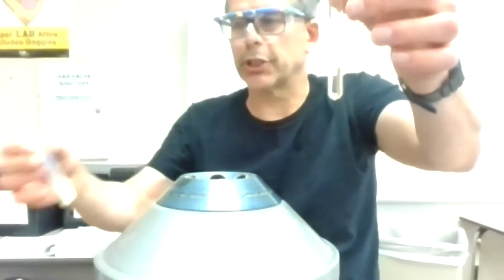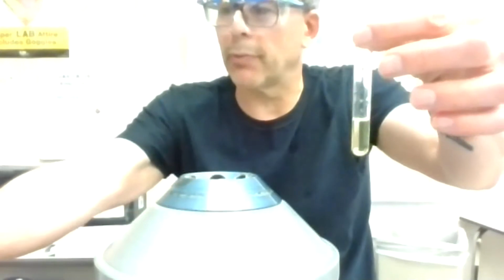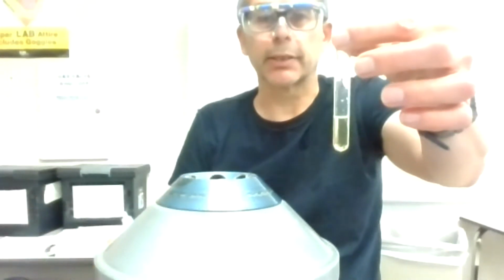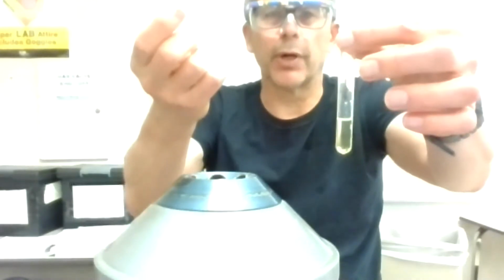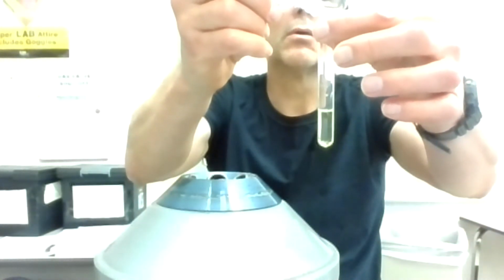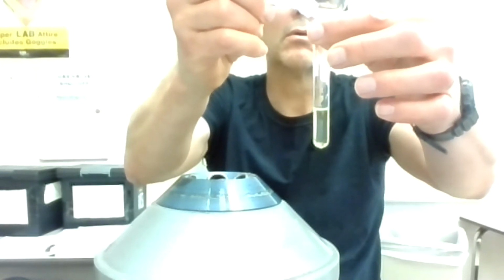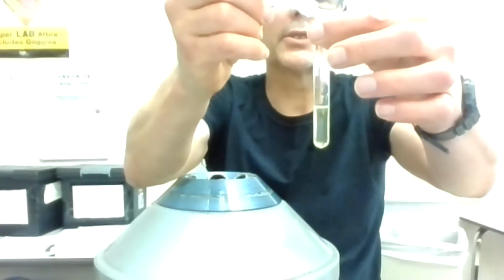Okay, the yellow tint tells me I probably have an excess of chromate, which is good, because if I have an excess of chromate, I should have used up all my barium, which I want to do because I don't want the barium to interfere with the next step. Okay, my next step, I'm going to add SO4. This is worth watching as I add this. And I usually add a couple extra drops here.